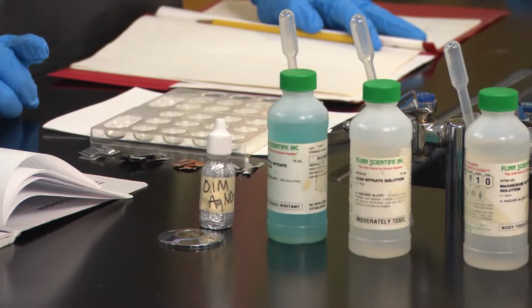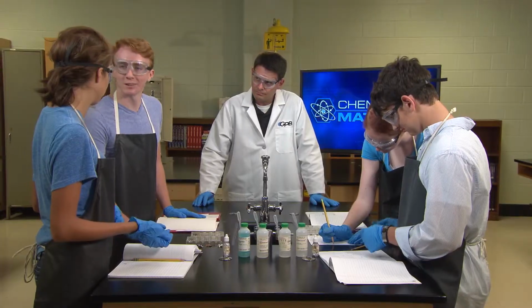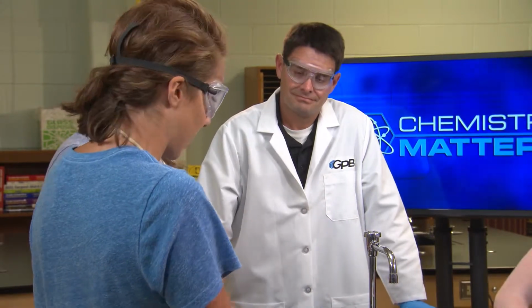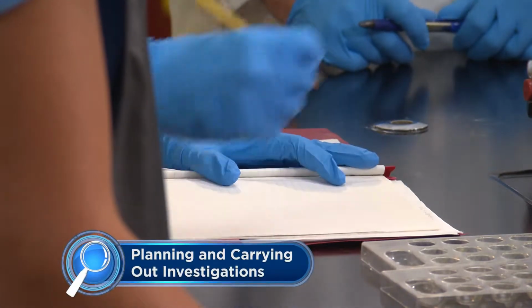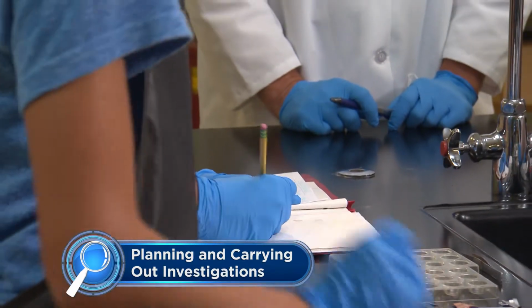Okay, we have all these different metals and all these metal nitrate solutions, and we need to see what will react. So what should we do first? Can't we just mix them all together and see what happens? We should mix everything, but if we do it all at the same time, we won't know what's reacting with what. Good point. I'll make a data table. Would you list off all the metals and I'll put them in the first column? Okay, magnesium, copper, lead, and zinc.